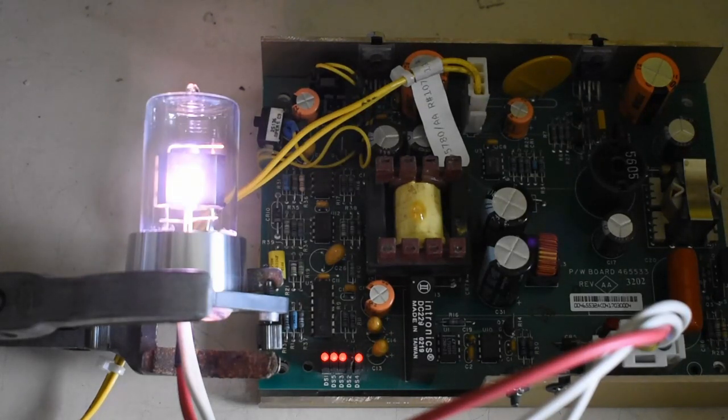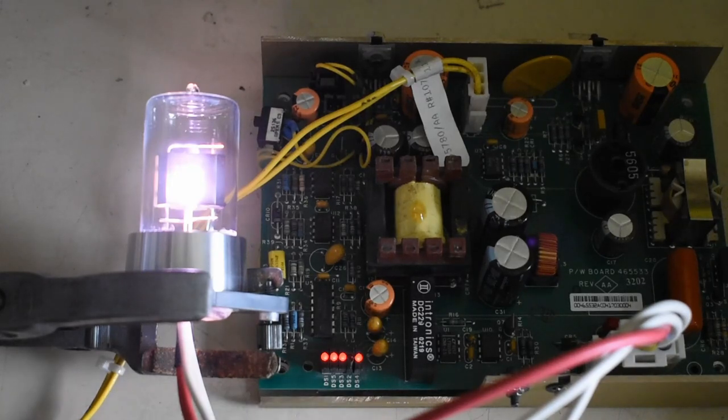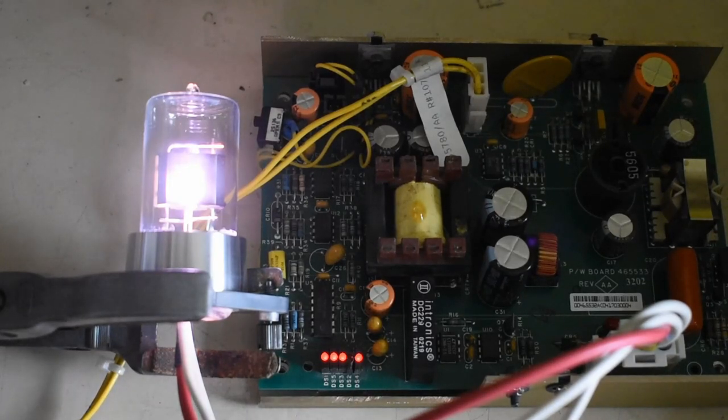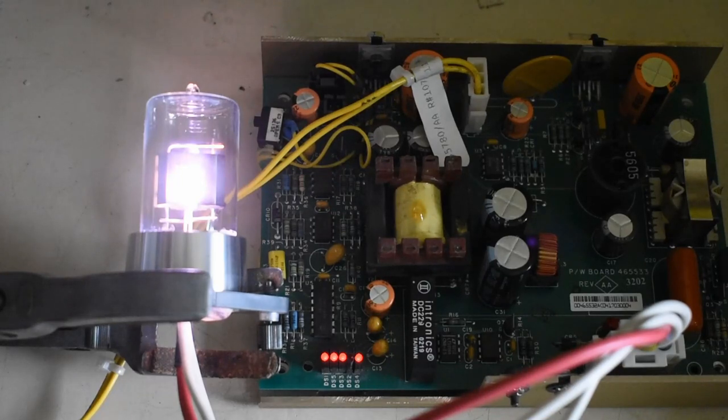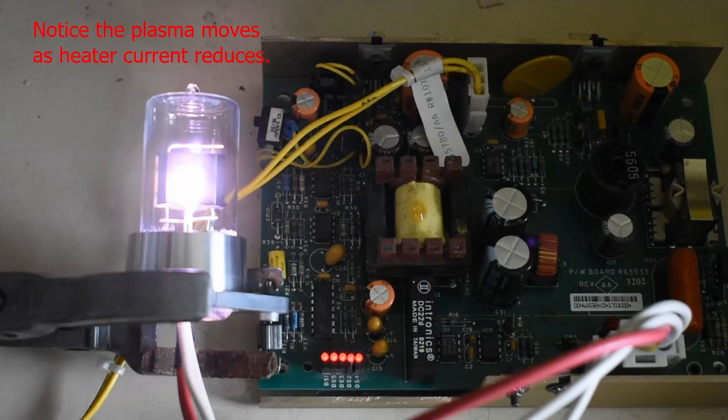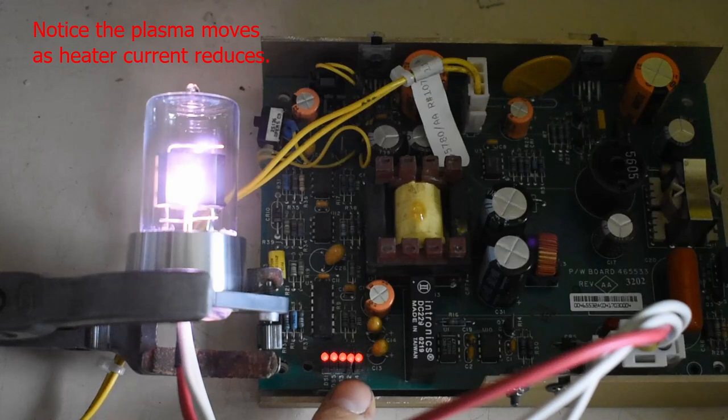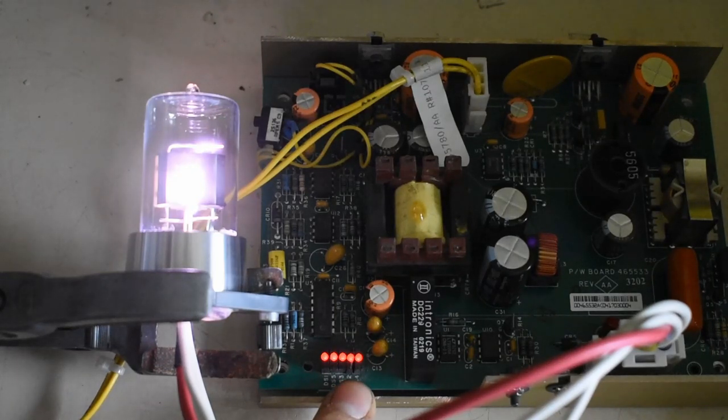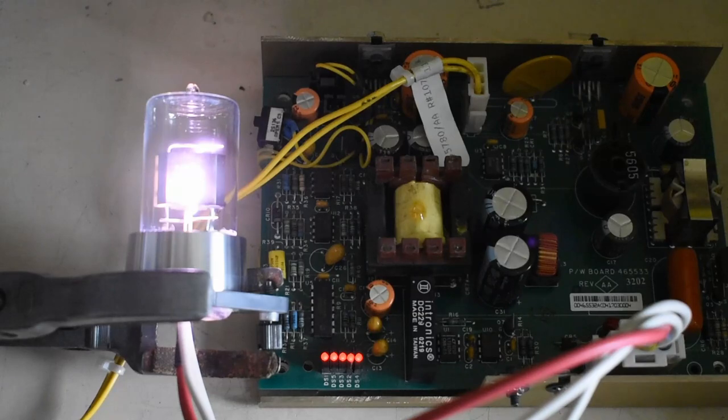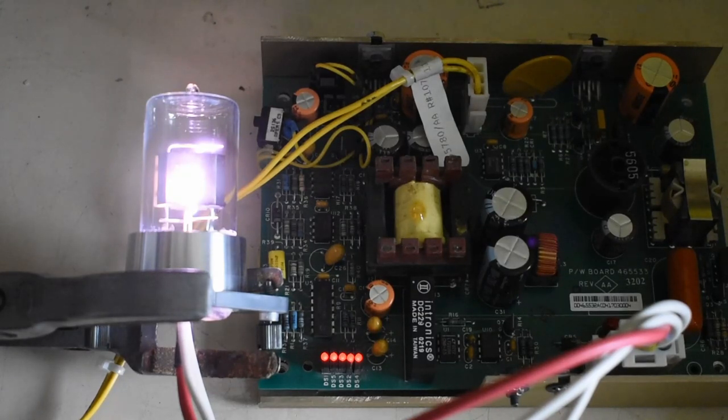That's the application of the start and you can see now the discharge is operational. Once there's the run up there that last LED indicates that the current on the heater has been reduced and the lamp is now running at full output.